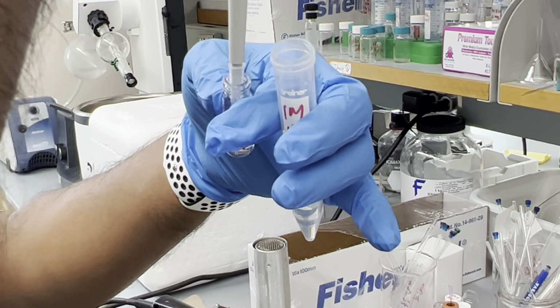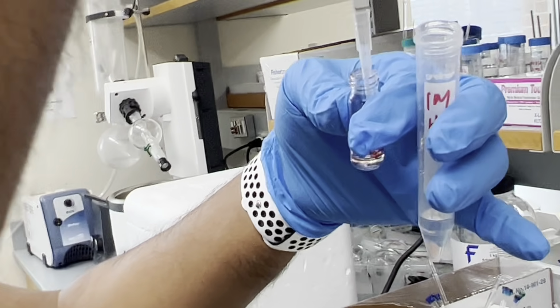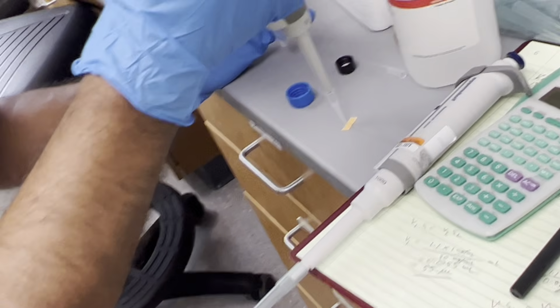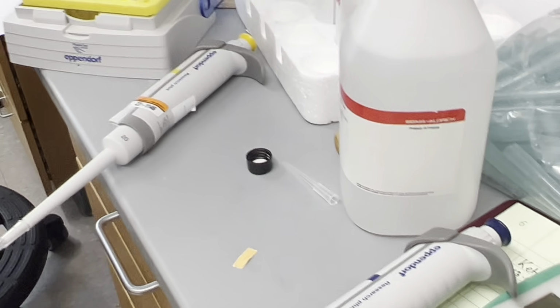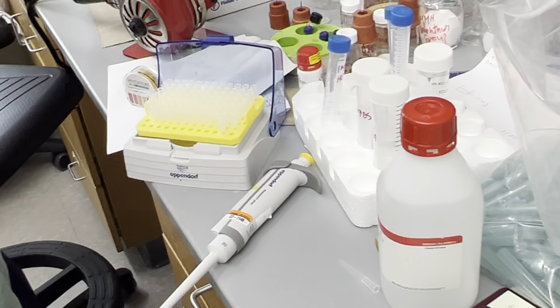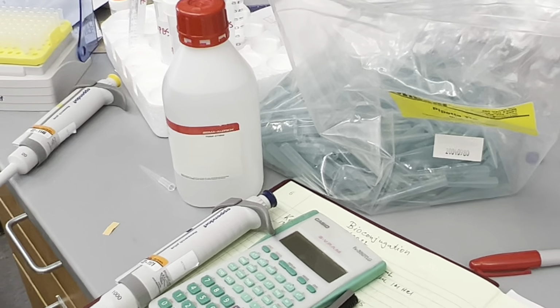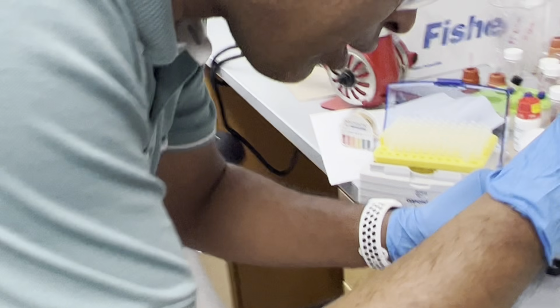Yeah. I'll better do it again inside this liquid, to release it in the liquid, you said? Yeah, rather than just on top. So now I'm going to use this part. By the way, if you were to vortex this, would it damage everything? Is that why you need to do the slow rotation? Yeah, that is during the bioconjugation, but now the vortex is not problematic. Okay. Oh, later on when it's already activated. Yeah. Okay. So I'll take a little bit here.